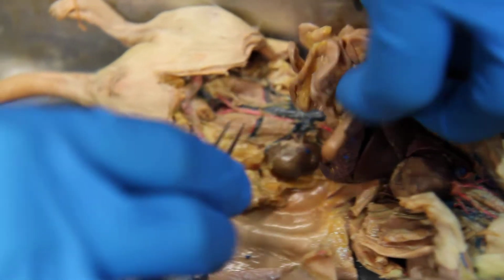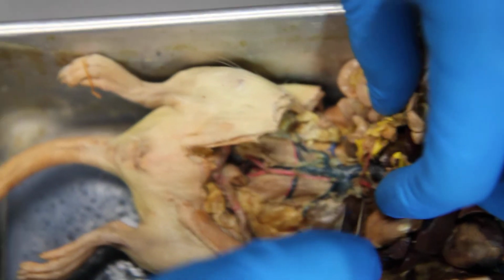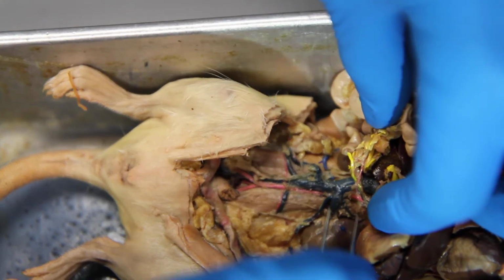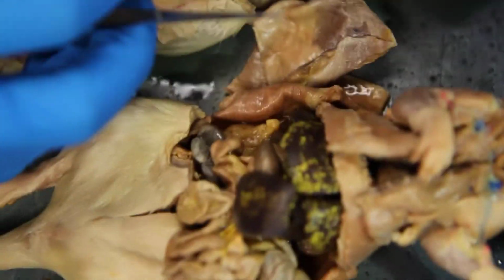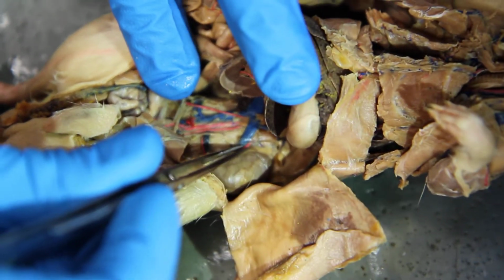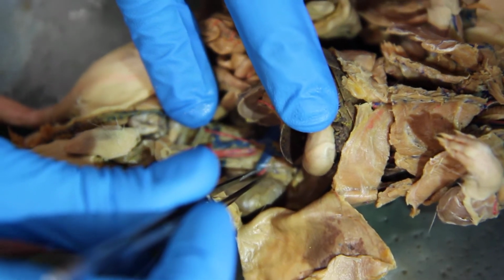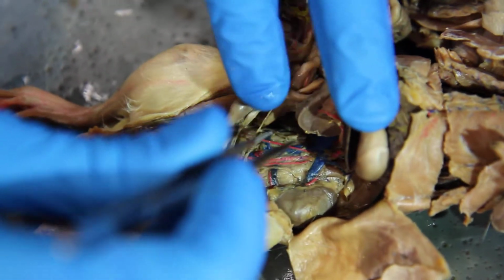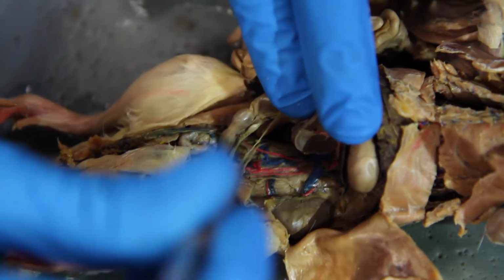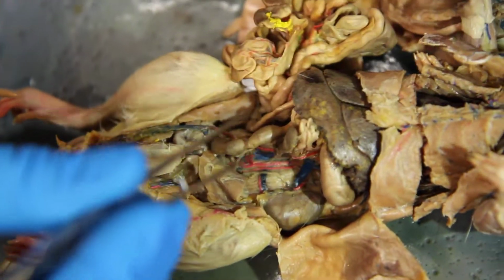So after that, there's the next renal artery. The artery that's going to this one. This artery. That's the next renal artery. So there you go, left renal artery. Alright, so now we follow the descending aorta again. There's going to be 2 arteries that come off like this. This is a male, so it's going to be testicular arteries.